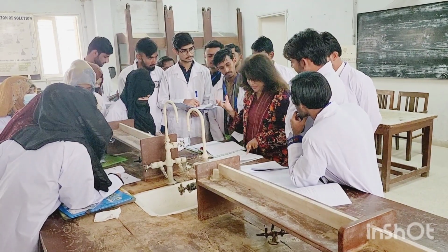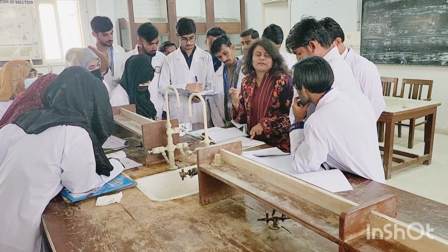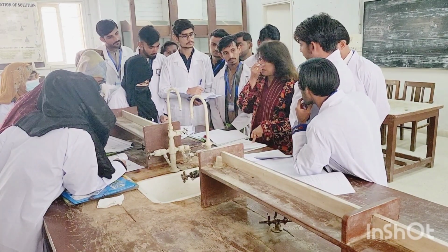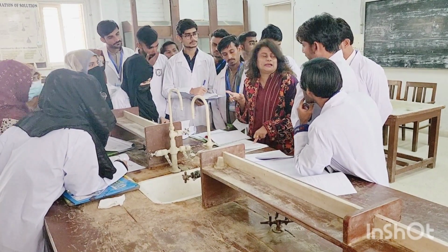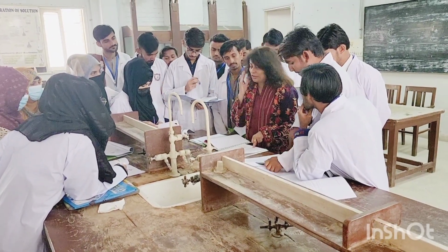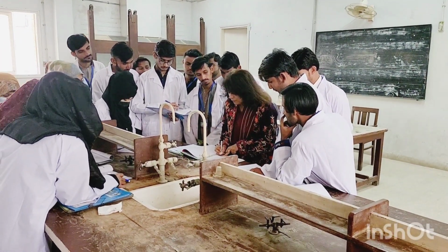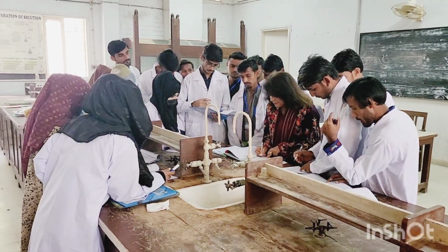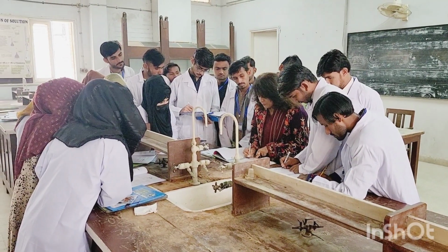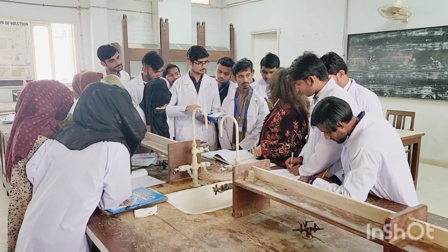If it is like that, then benzoyl compounds, nitrobenzenes, these kinds of compounds are there. Okay, then the fourth option they have given us is pungent, causing irritation. So which ones are these? These are some chloro compounds. You'll suddenly start sneezing and coughing, and you'll feel, oh yeah, it is pungent. It is causing me some sort of irritation. So you will write that, and you will write "may be present." In every result, at the end you are going to write down "may be present."